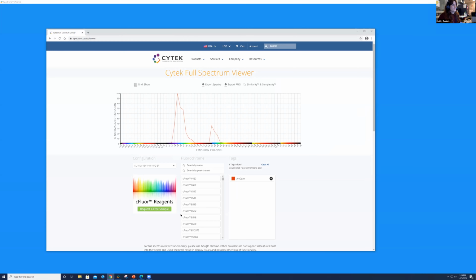The two different fluorochromes that we're going to work with today are Pacific Blue and BV421 for the start of our experiment, okay? So you see right now, someone else has previously used this at the instrument. So I'm going to X out of that fluorochrome, which is AmCyan, and we have a blank slate to work with. Okay? It's important when you go to use the full spectrum viewer from Cytek that you choose the appropriate configuration for your instrument. So we're working with a 5 laser Aurora unit today. So I make sure that that configuration is chosen.